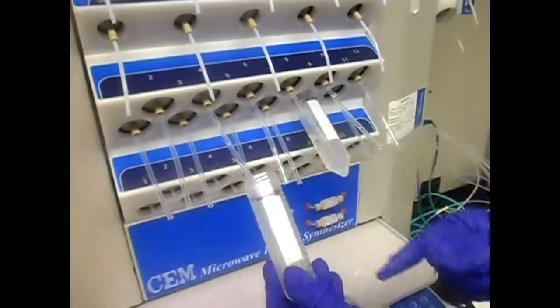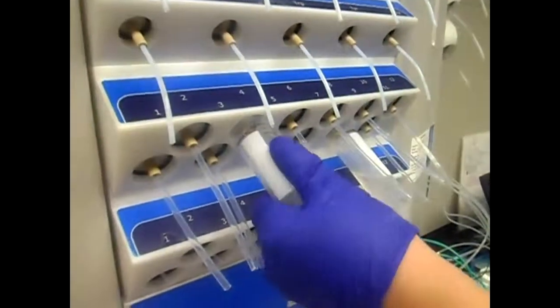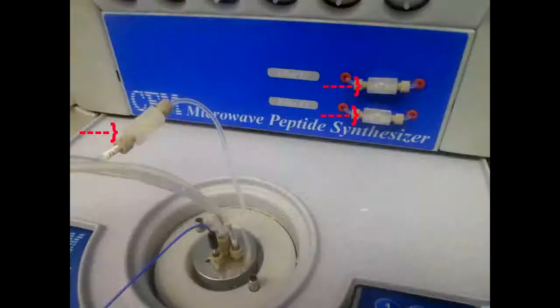The resin is attached to the resin feed tube without a filter, since the resin needs to be transferred into the reaction vessel. After a few runs, 3 inline filters have to be switched out in order for solvent to flow smoothly. These filters are screwed in from each side.